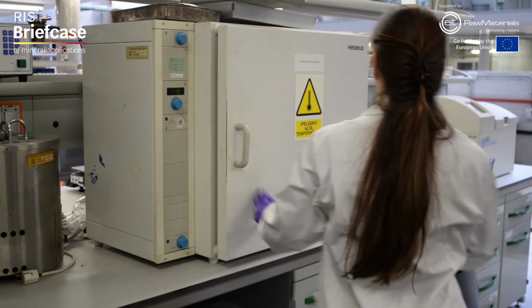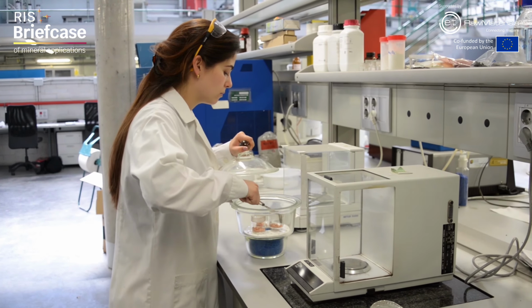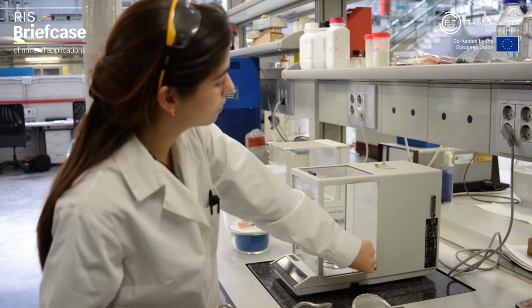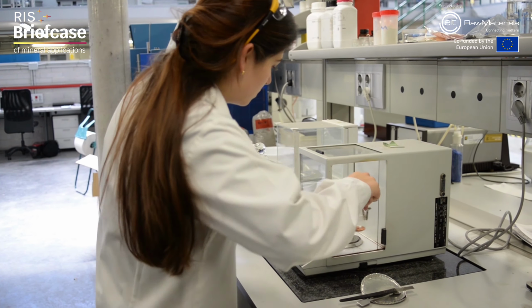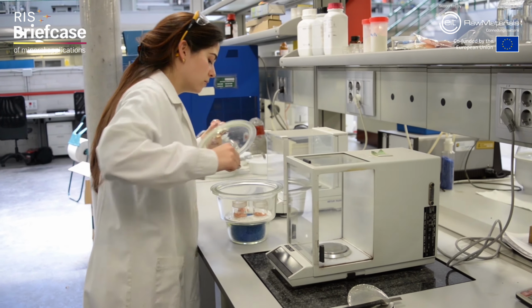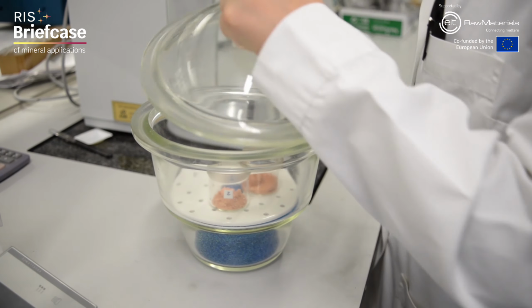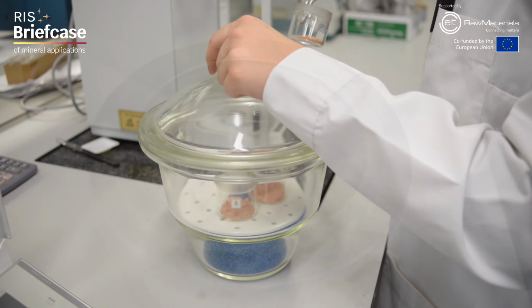As we want to know the weight only of the soil sample, we evaporate the water and thus the result will be reliable. In addition, it's important to measure the amount of moisture present in the sample. This is done empirically. The sample is dried, the mass is weighed and noted. This glass container is called a desiccator and is used to cool the samples without acquiring ambient humidity.